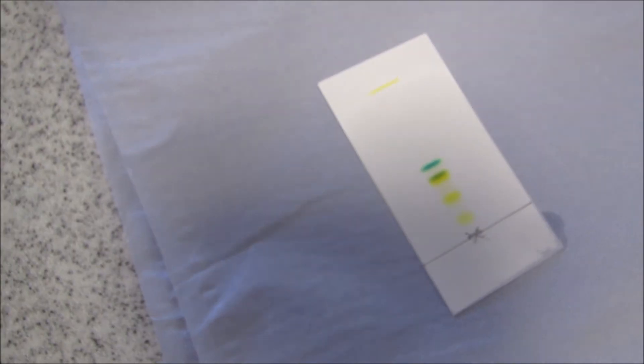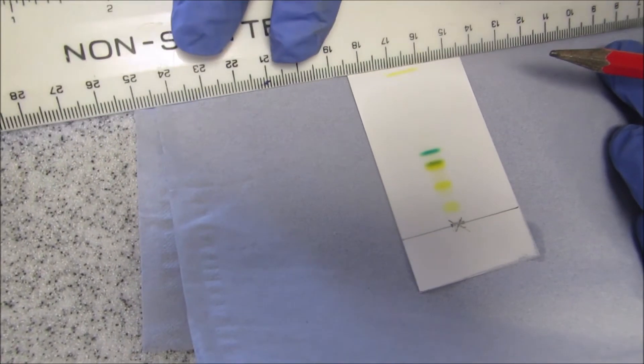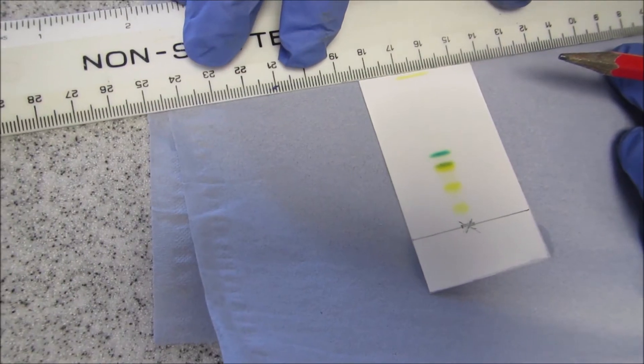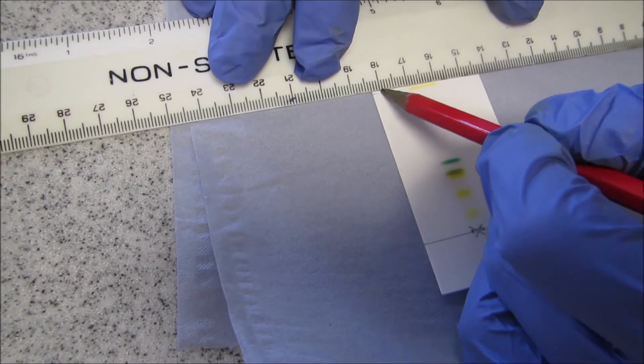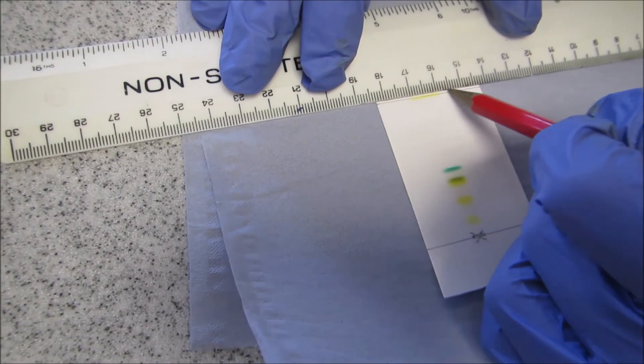So now, I want to mark the solvent front. So it dries very quickly, and it was just at the top of this yellow line. And that's my solvent front when you come to calculate.